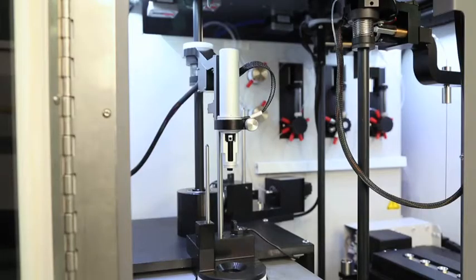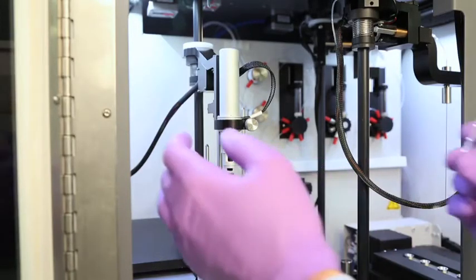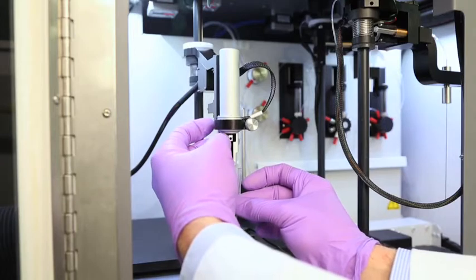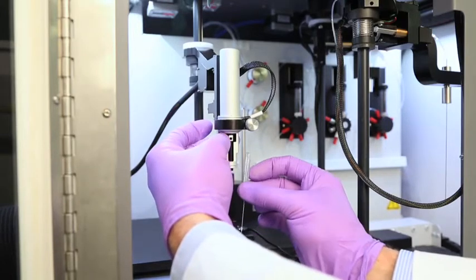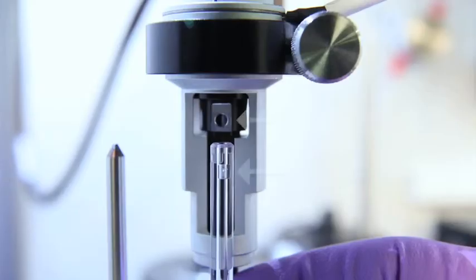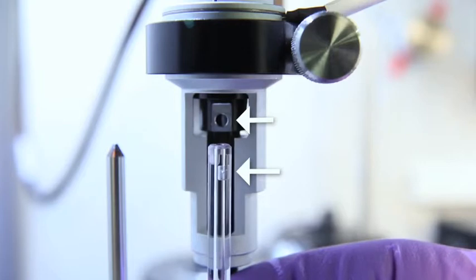To install the syringe glass, grasp the pipette's rotating assembly. Gently insert the syringe glass with the syringe's fill port facing the same direction as the hole in the pipette's rotating assembly.